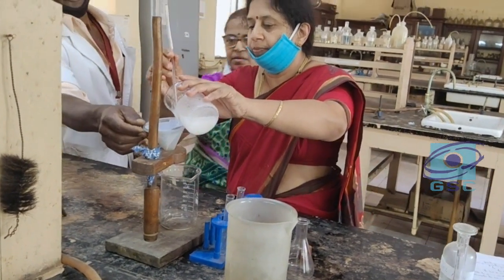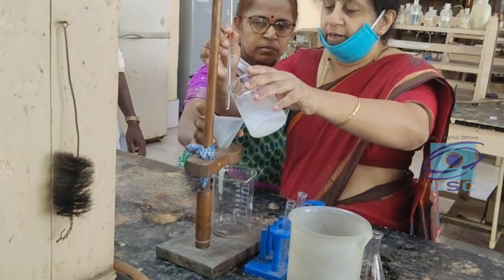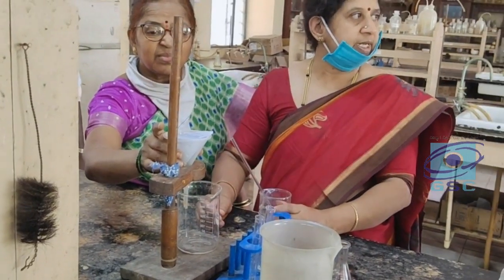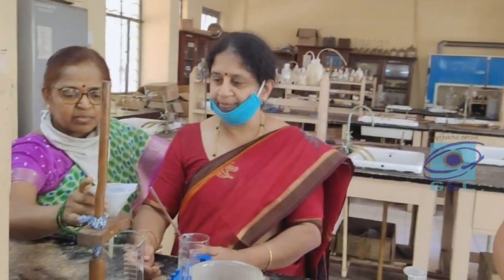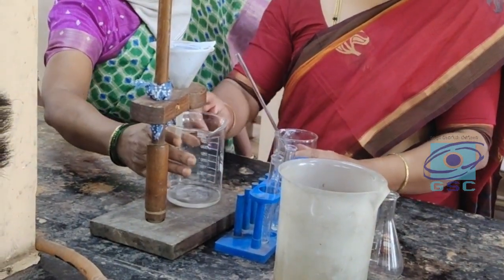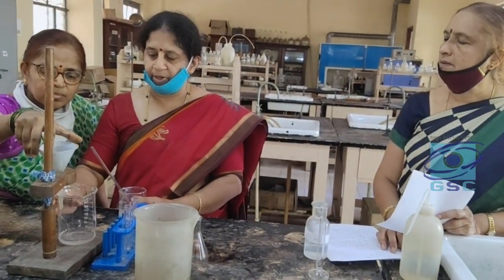Are we going for ordinary filtration? It should be ordinary filtration, madam. We do not need any suction pump, though preferably a Buchner suction pump can be used, because the yield of the compound is very high. And we are using ordinary filter paper here.